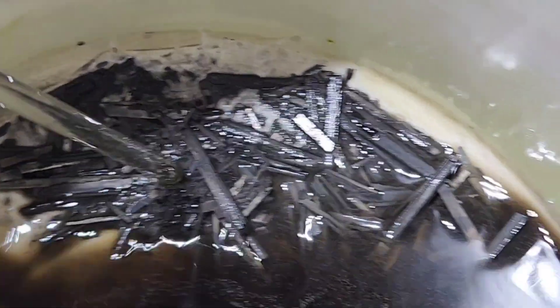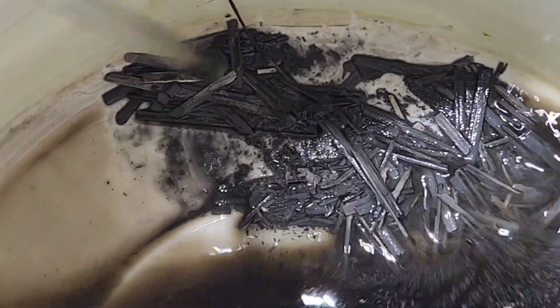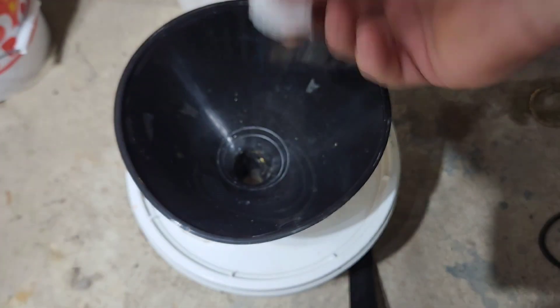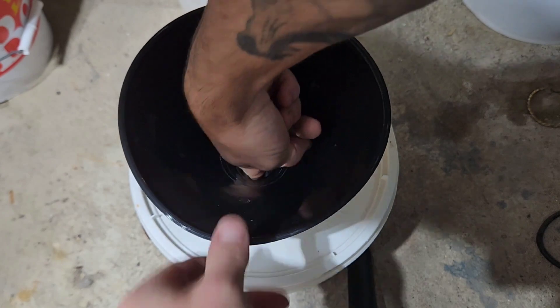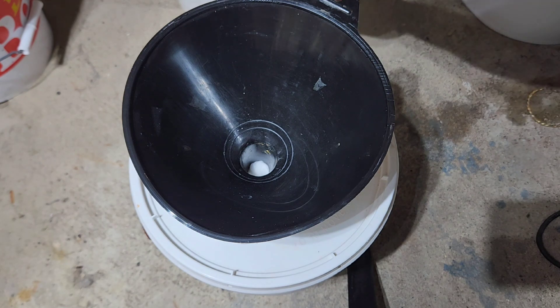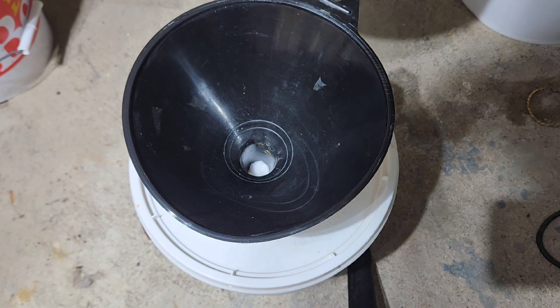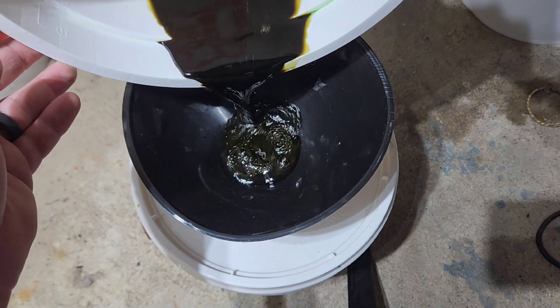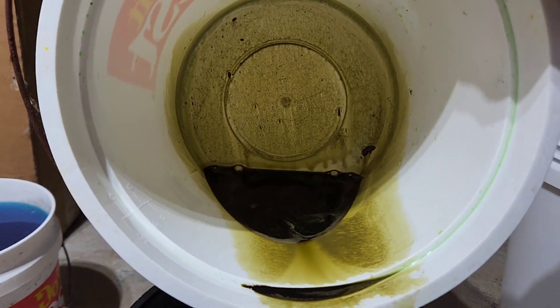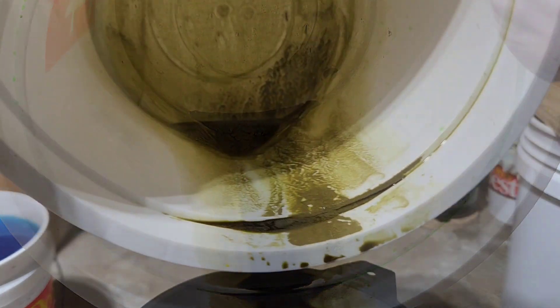It's about two weeks in. I did have to add a little bit more HCl to make it a little more potent, but I think we're good. I'm going to do a cotton ball filter for this stuff — see if we can get all the material off the bottom and let it rip. That's what's left of the silver — we're going to need backup for this one.